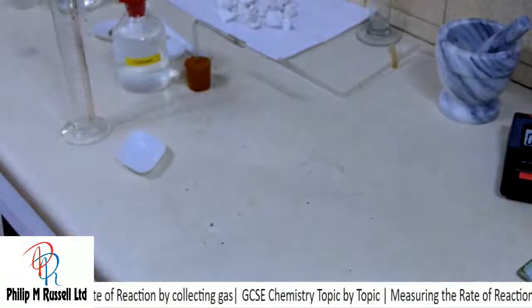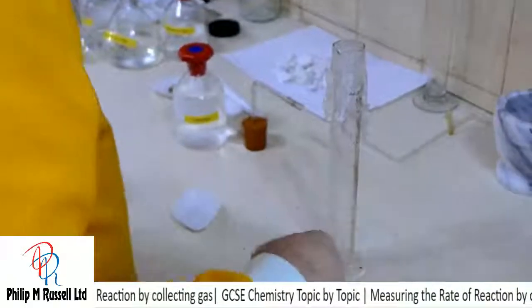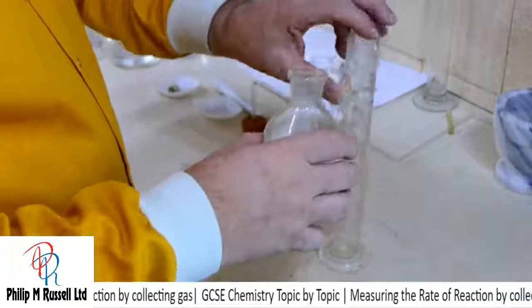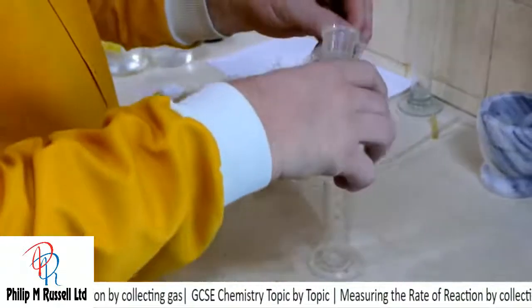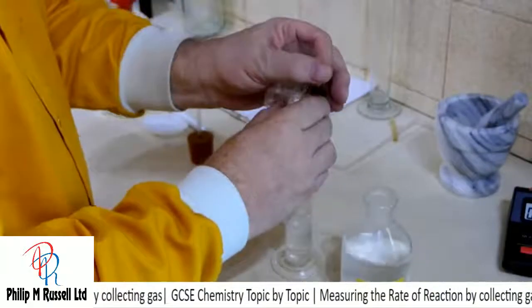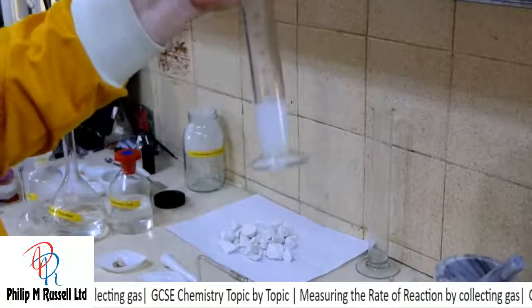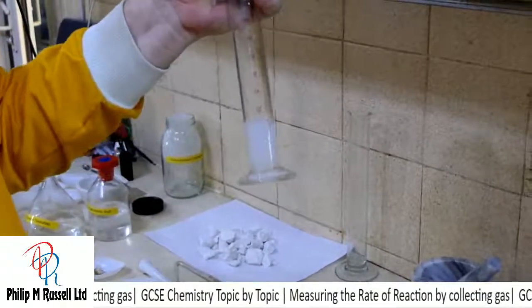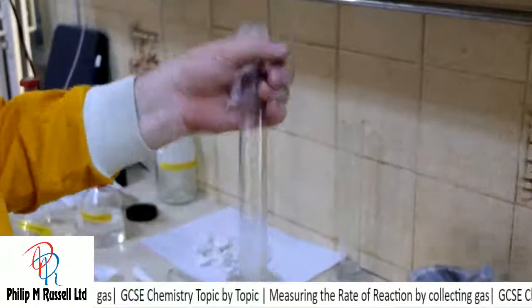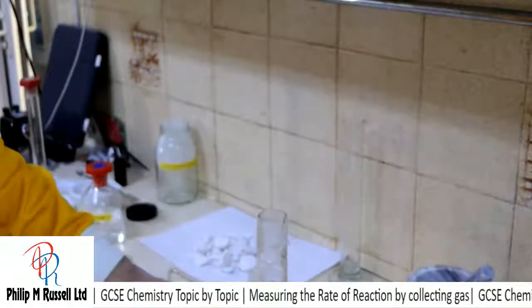I've got then this with some carbon dioxide in there. I'm just going to take some lime water and put some lime water in there quickly. And if I shake it up, it's gone cloudy, proving that I actually did manage to make carbon dioxide.